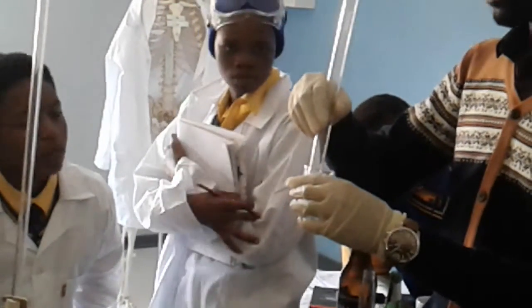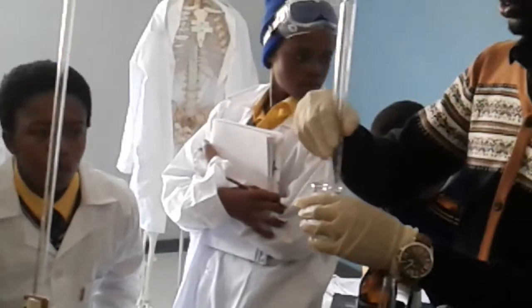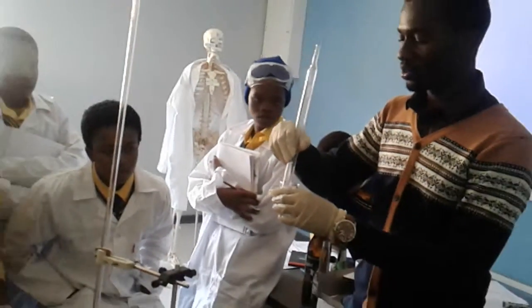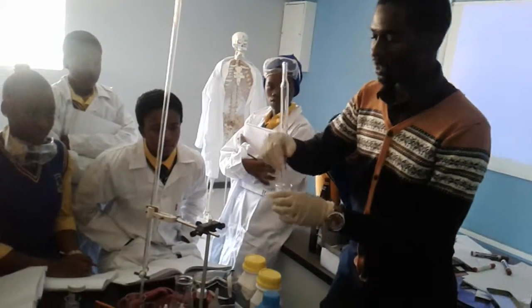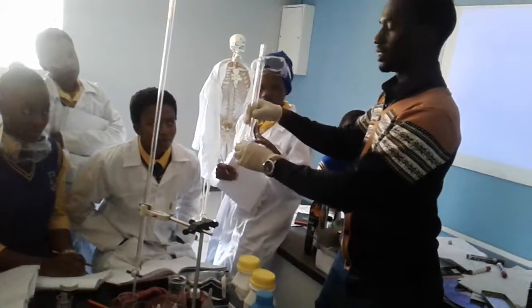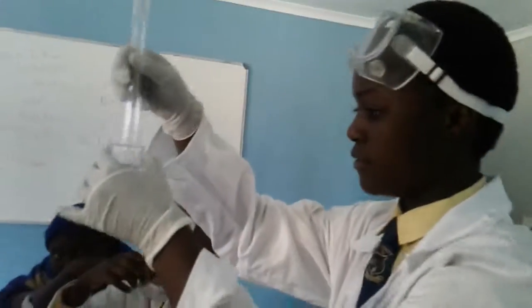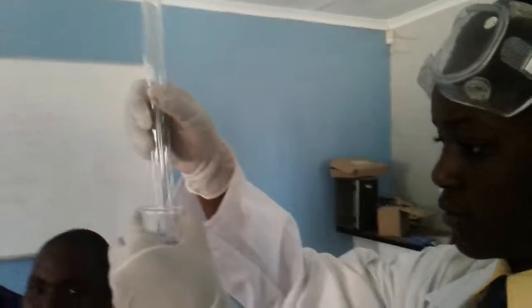you don't mix with the pipette, right? It's just that I don't have a spoon. Yeah. What if it breaks? Good question. Someone quickly resolve this. These two things. Someone. Guys, okay, time to do it. Assistant. Alright, continue. Any questions so far?